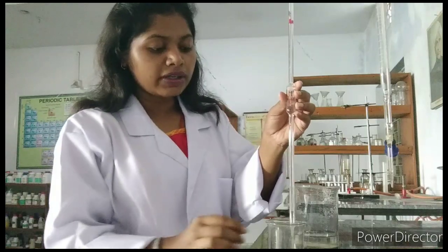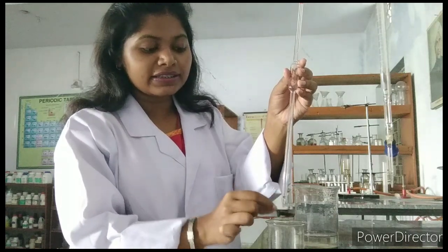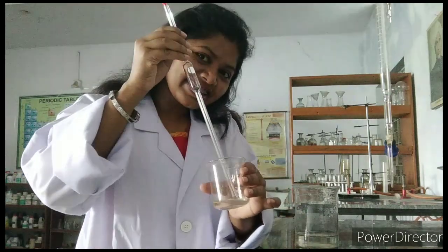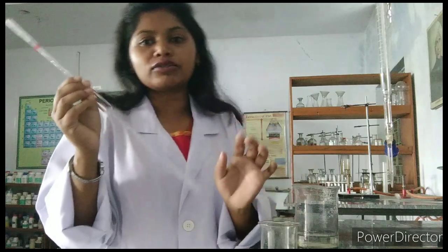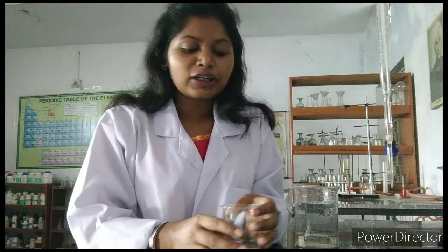When the water goes out completely, you can see that little droplets are coming out or a little amount of water remains at the bottom. So what we will do — we will tap two times at the bottom of the vessel so that whatever little remains here will get out. This is the way to use the pipette, and you can measure the exact volume of whatever liquid you want for your practicals. I hope this is helpful for you.